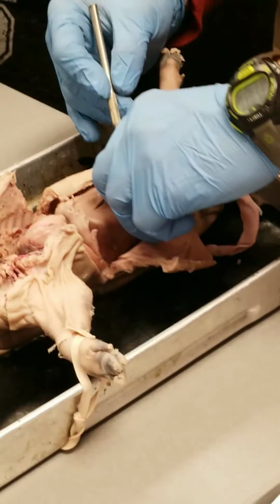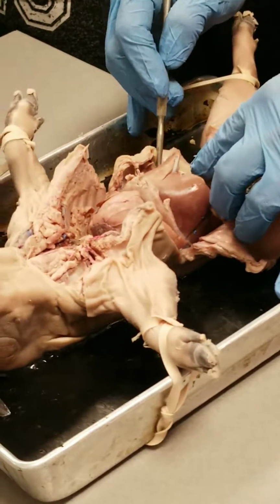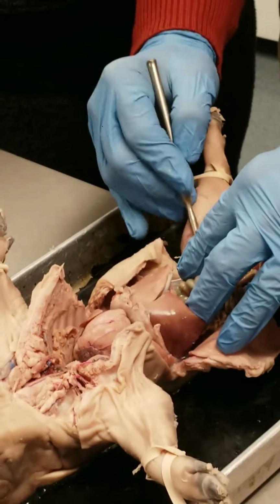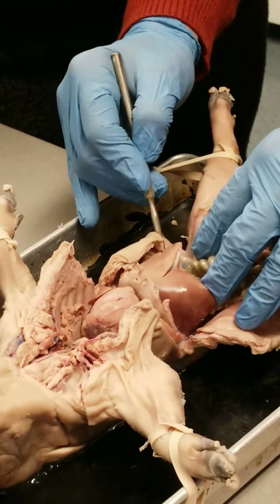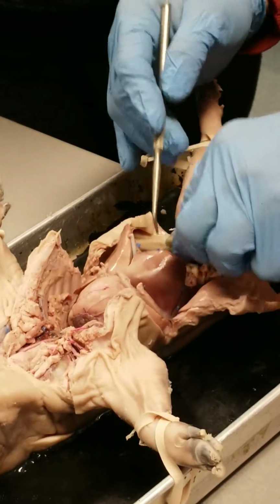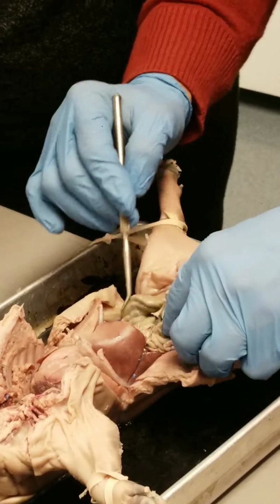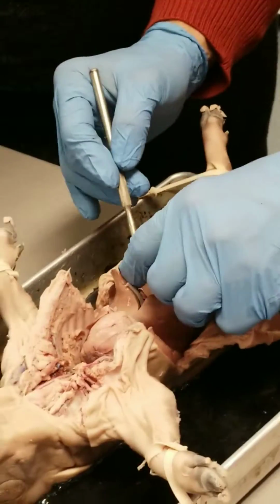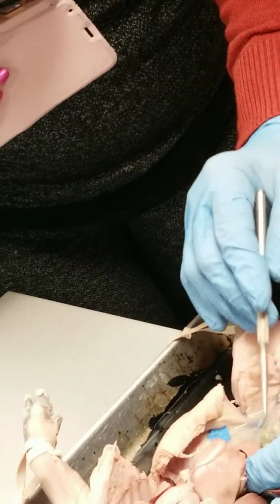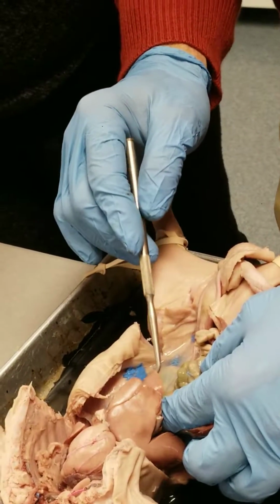Let's see, what else? If you displace things to the side a little bit, you can get back and see the posterior body wall. It needs to suck up a little juice back here, but there are other organs here. So that's small intestine, mesentery, large intestine or colon. Right here, this kind of looks like a tongue. This brown organ right here is the spleen.